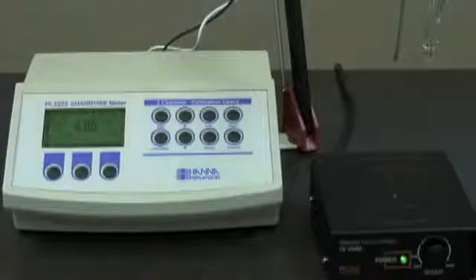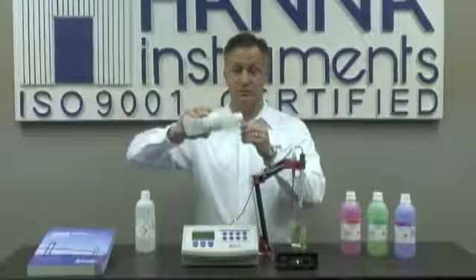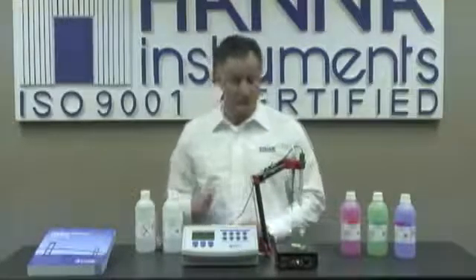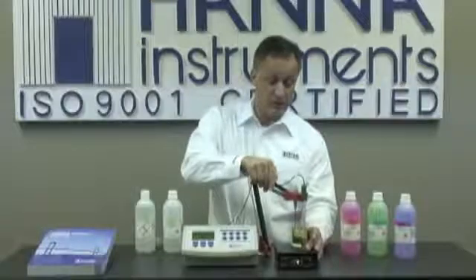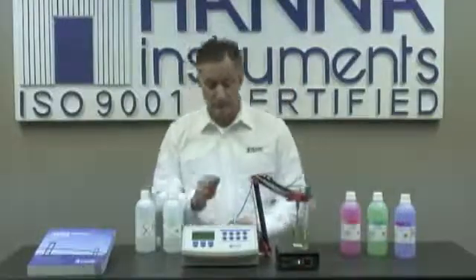Now we are ready to take our measurement. Some final notes: it's extremely important to keep your probe conditioned after usage. I recommend using storage solution HI-70300. If you choose to store it in the probe's protective cap, simply pour some storage solution in the cap and put it on the probe. If you don't have storage solution, it's okay to keep the probe in a buffer — preference is 4, and if you don't have 4, then 7 is okay as well. Never keep the probe in deionized water. If your instrument ever displays 'clean electrode,' that's an indication of a dirty probe — in that case, we offer application-specific cleaning solution.